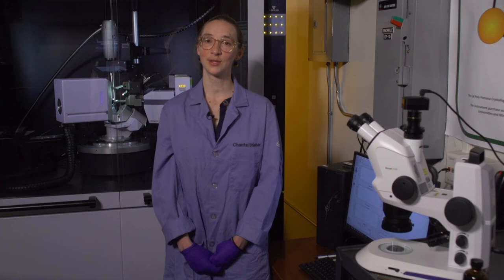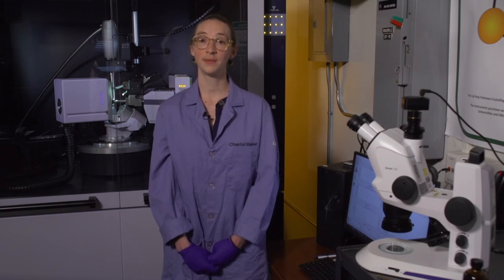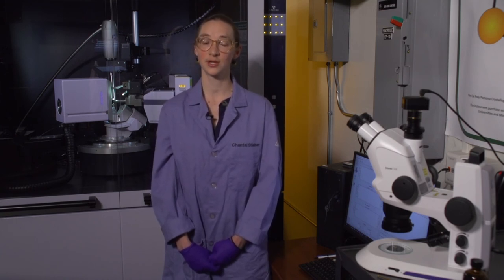This concludes our three-part video series on using a single crystal X-ray diffractometer for determining the 3D atomic structure of a molecule.